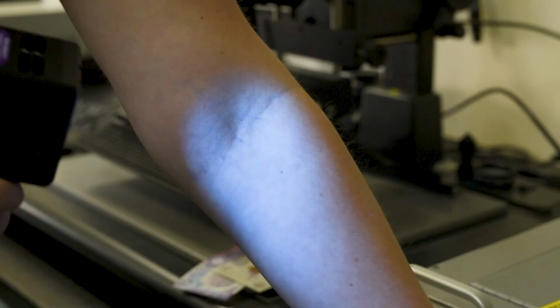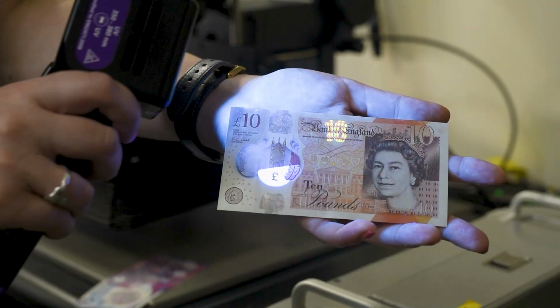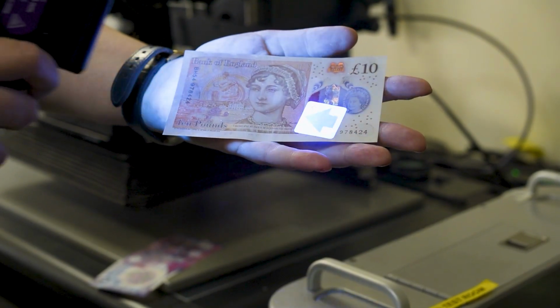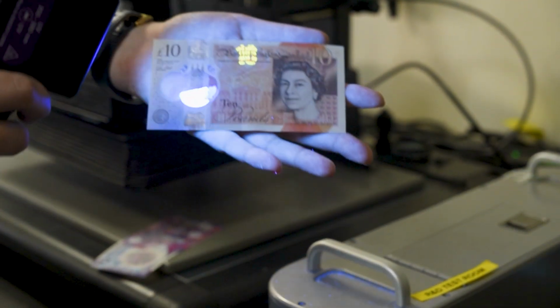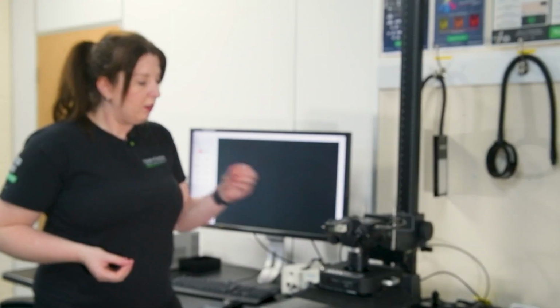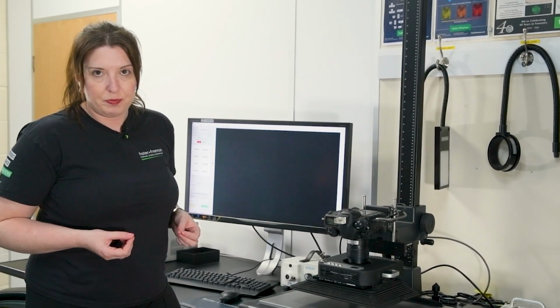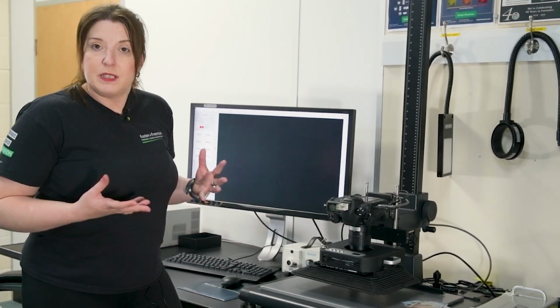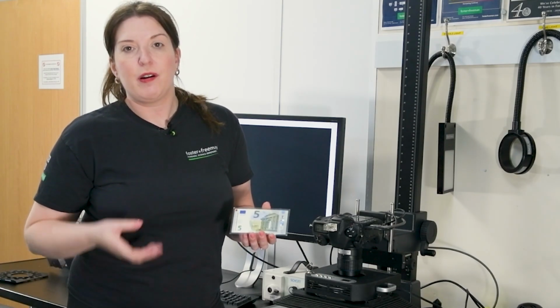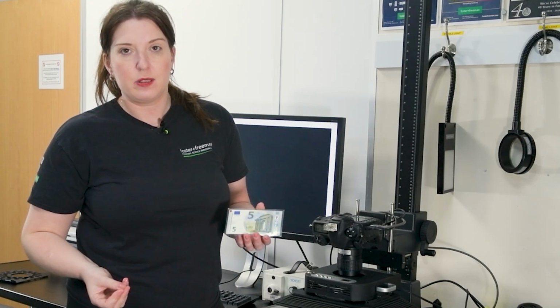Sometimes there's only a few small security features, and it may be okay in the areas where your fingerprint is not over those security features, but it is a consideration we actually have to make. So sometimes the methods that you use on other more simple sample types are not going to work as well on these more challenging samples. So let's have a look at a couple of different ways that we can either use lighting or the software to help us to visualize these fingerprints. So let's first have a look at some different lighting techniques that we can use.